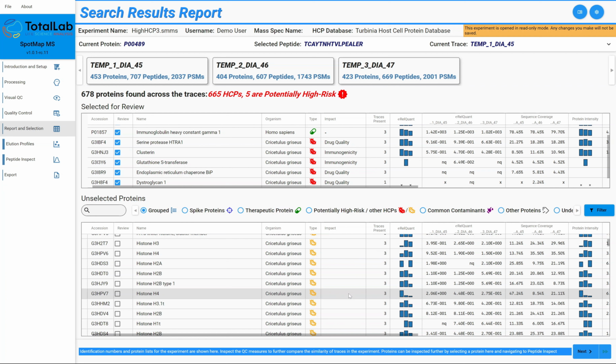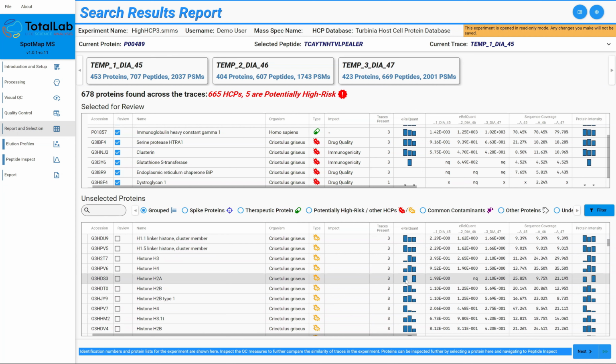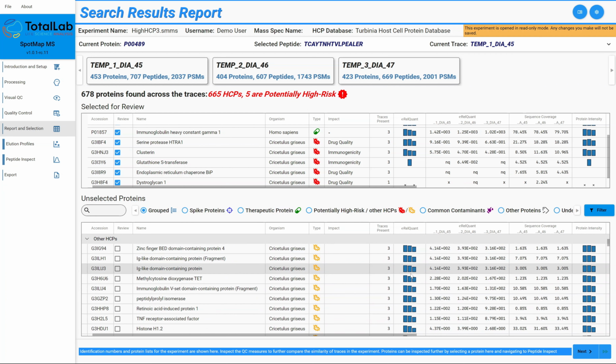In this example, this histone H4 has been detected in a much greater quantity in trace 1 than 2 or 3. But what we were also doing is showing very, very small columns like this one, even when the result was 0 or not quantifiable. We've removed that now, so it's even more visually obvious if one host cell protein is detected in 2 traces, but not the third, for example, here. So we've built that into our workflow to allow users to only focus on the host cell proteins that they would deem present. So not a false positive, a true positive.